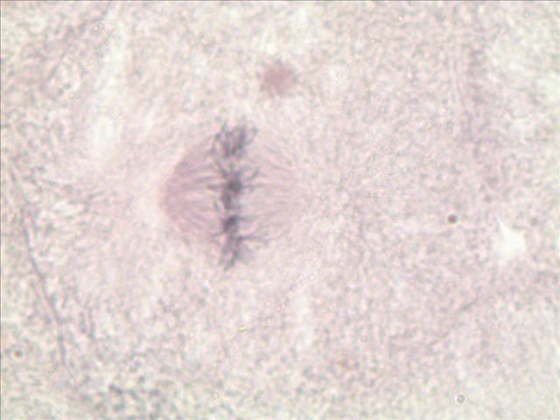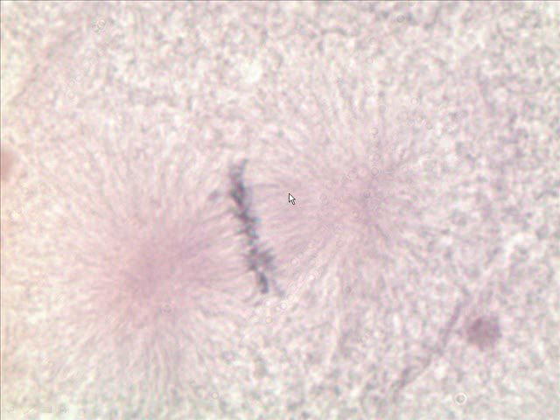Metaphase. Here's another metaphase. Chromosomes all at the equator of the cell. Here's the spindle fibers. Metaphase. Here's another metaphase. Chromosomes at the equator of the cell. Here's the spindle fibers, of course, and metaphase. Okay, what do we have? Oh my goodness!